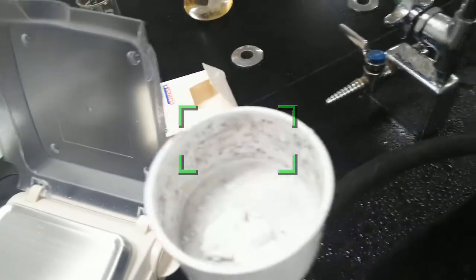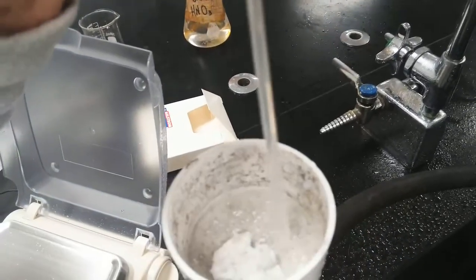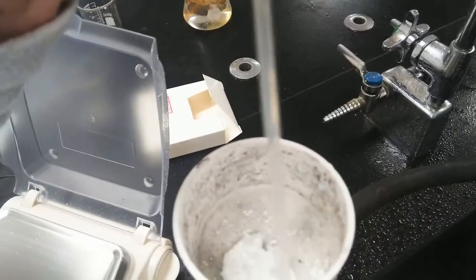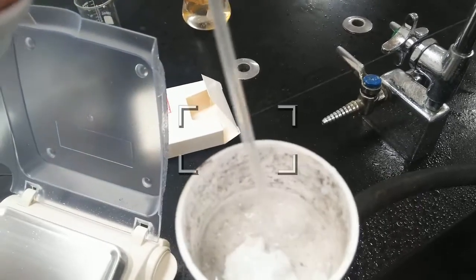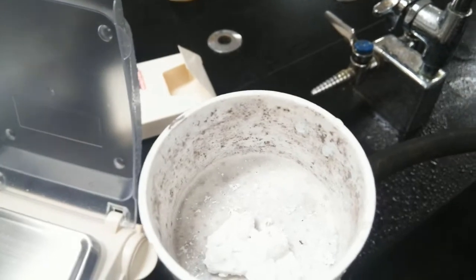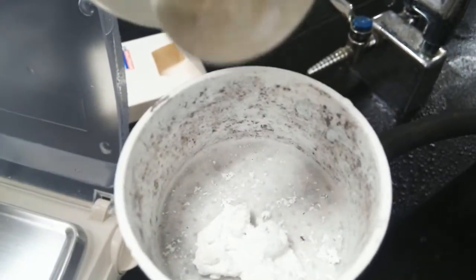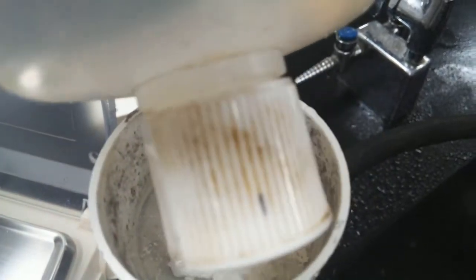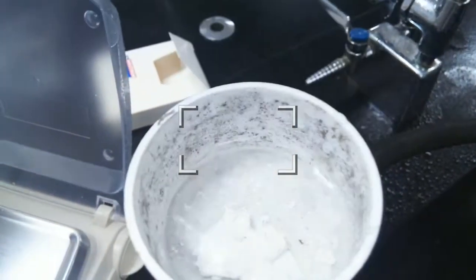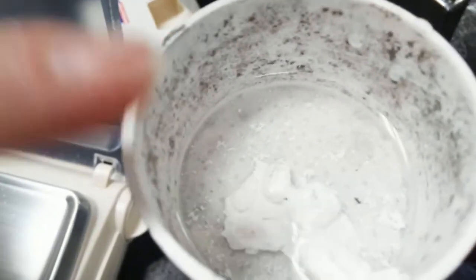They also mention adding a little dilute nitric acid, just to make sure that my precipitate doesn't get to be like fine particles that would eventually go through the filter paper. And then we're going to rinse this with a little more distilled water. Make sure I get all that extra acid out. I don't want any copper up here.